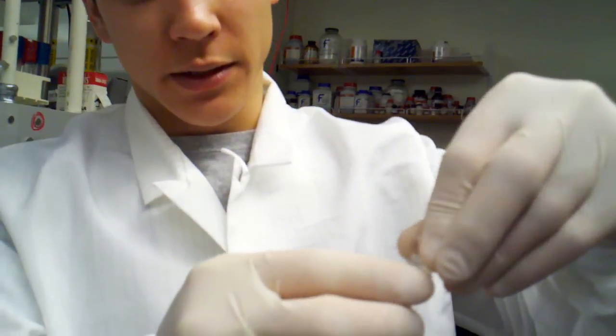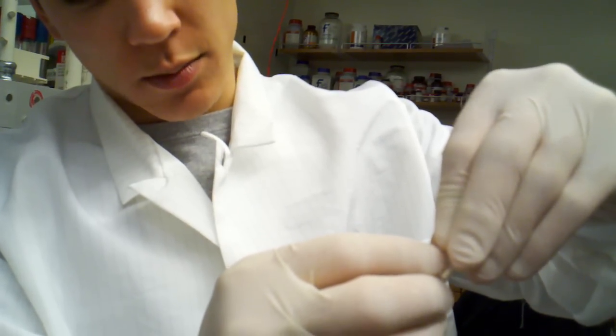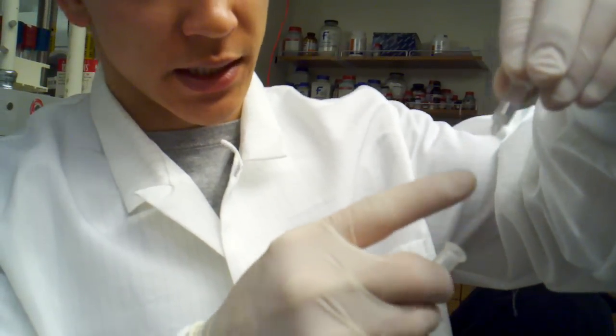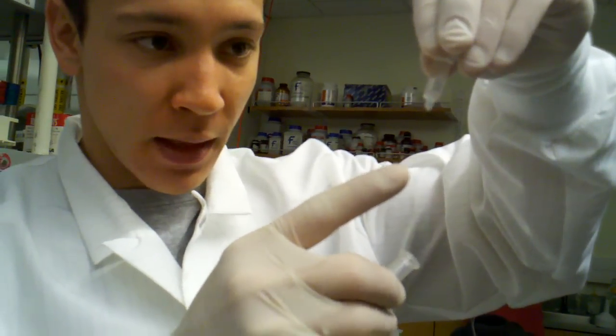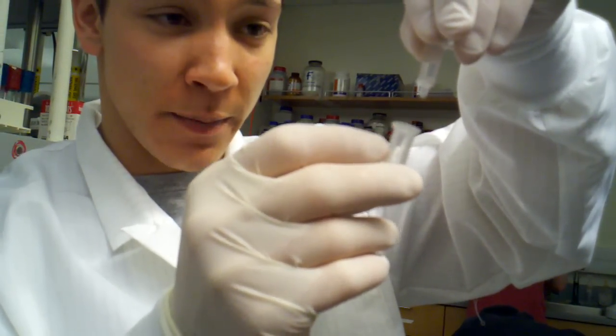I'm going to try to cap this without losing too much DNA. Cap it slowly; might force some of it through. You can see that it's dripping down now, and we want all of this liquid to flow through that white membrane right now. That white membrane is going to capture our DNA.